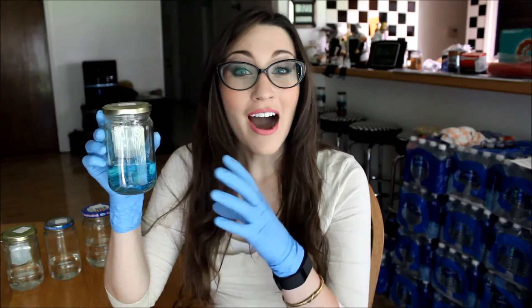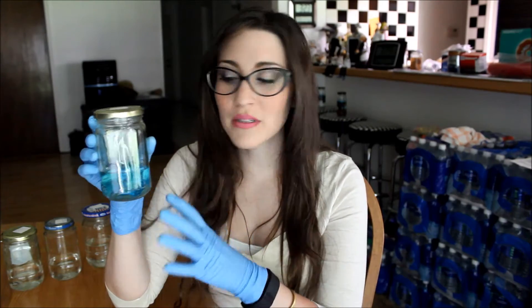I've placed the bird into the first solution which consists of 95% ethanol. It is going to be sitting there for about a day and then I'm going to be transferring it to the second solution which also consists of 95% ethanol. I had to add a little bit more than 100 milliliters to ensure that I covered the entire bird. Day two: I'm going to be transferring my bird from bath number one into bath number two which contains 95% ethanol, and it will stay in there for the next 24 hours.